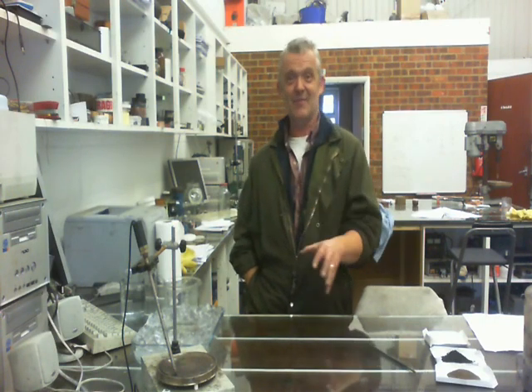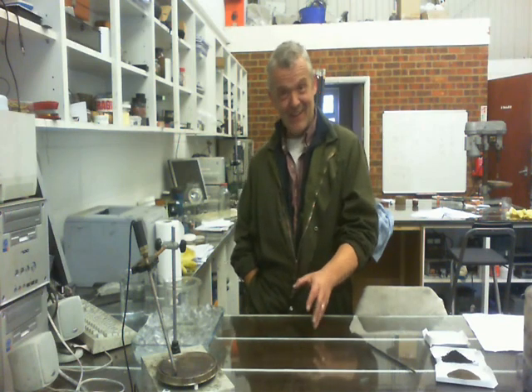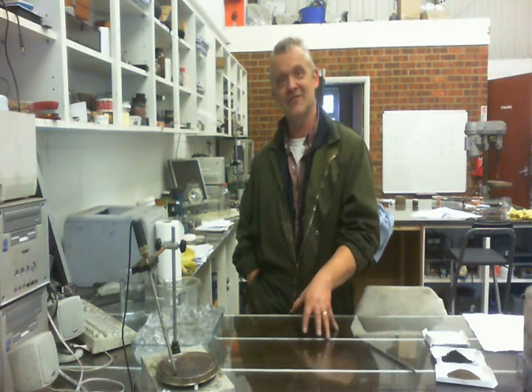Jeremy's actually an engineer. He's not, in fact, a chemist. It's the first time he's actually done this, so it's really cool. So in a minute he's going to take over, and we're going to phase two.